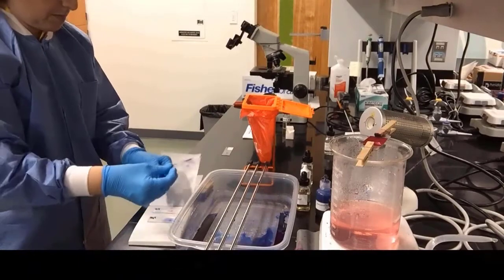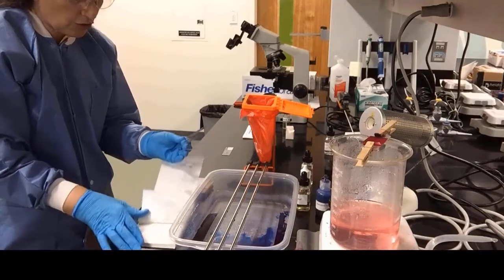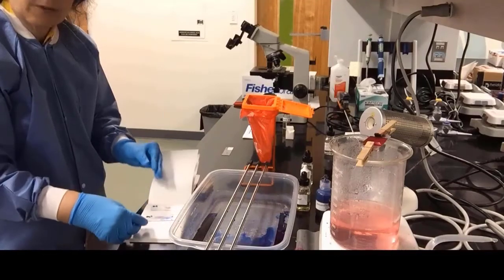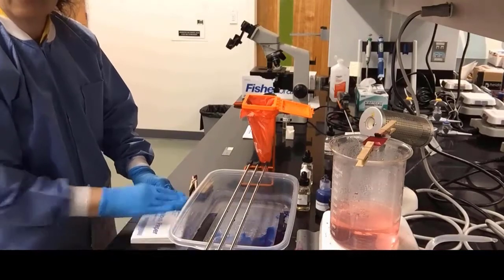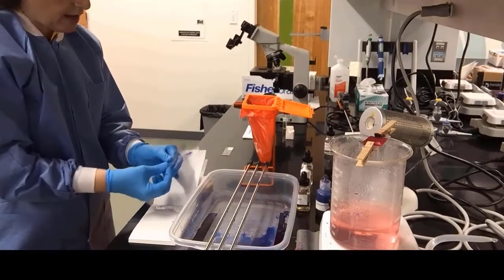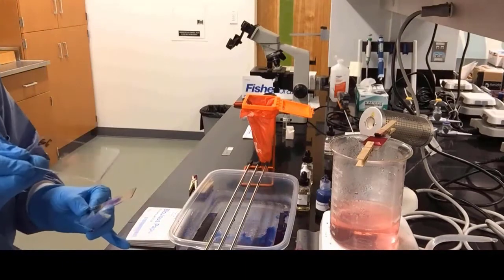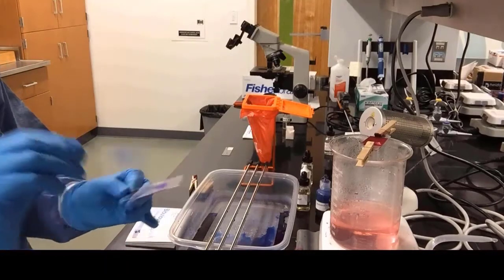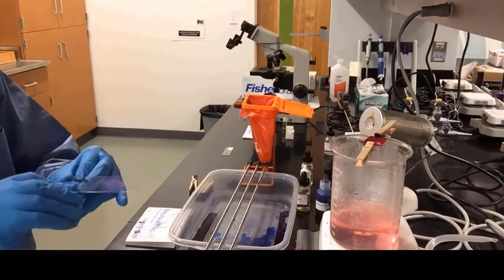Most of the times the slides don't dry with the first attempt, so we will find another 2-page area where we can put our slides in between 2 pages of our bibulous paper and dry them once again. Our slides now are ready to view under the microscope, but remember, we don't want to get the stain or the bacteria on our lenses. Our smears look very nice. They're all nice and dry and stained.